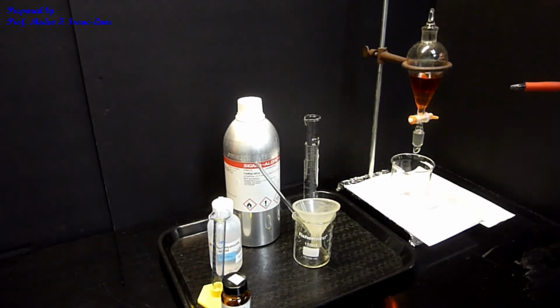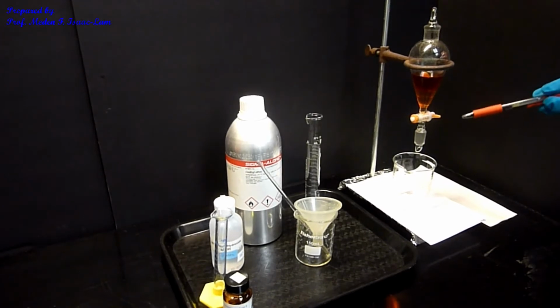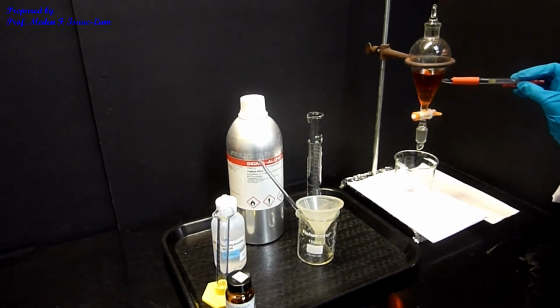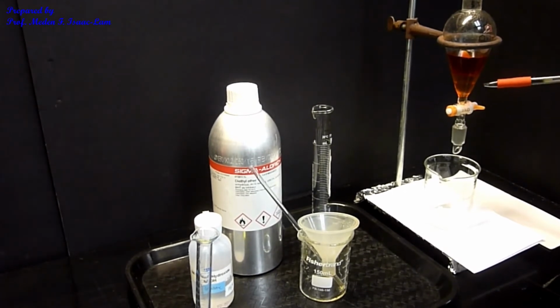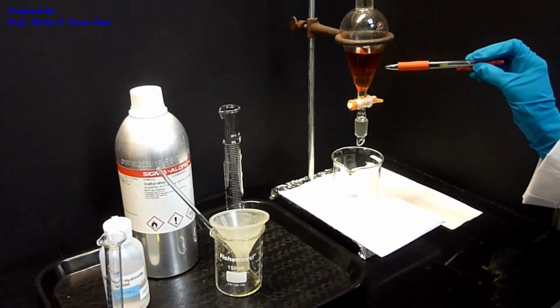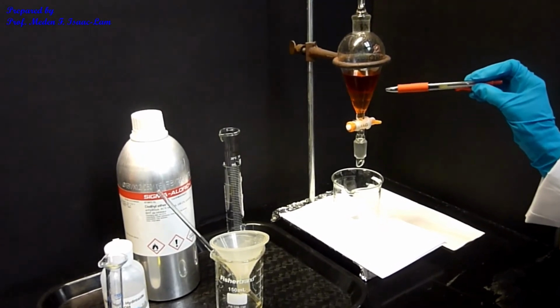So there's always going to be an organic phase and then an aqueous phase, although the organic phase can be either the upper layer or lower layer. In this case, it's actually the upper layer because the ether has a lower density than water, therefore it's going to be on top. This is my ether layer containing the 2 other components, which are the amine and then also the neutral component in my 3-component mixture.